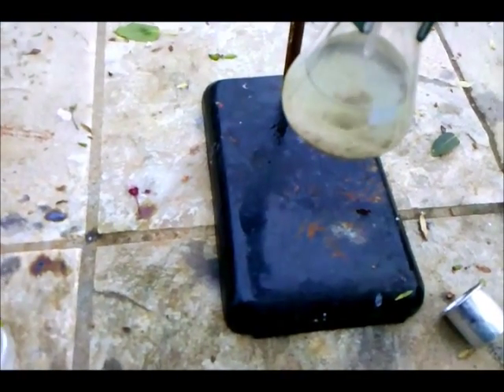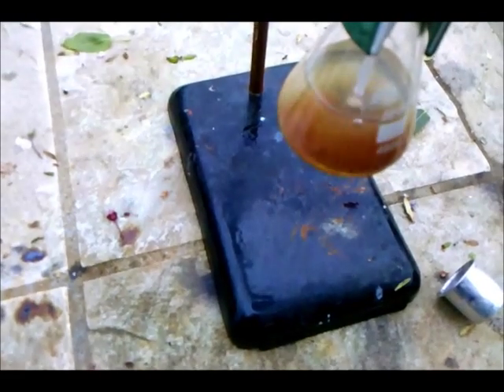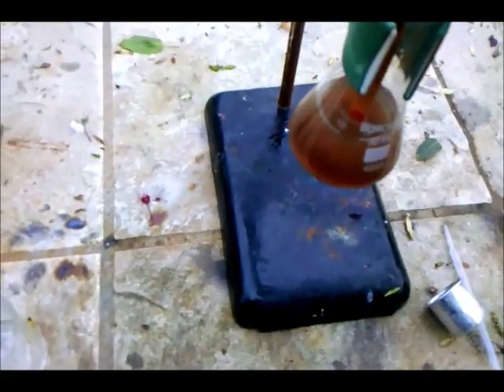So some potassium hydroxide is taken up and added to the mixture. You see the solution darken — continue to do this and take pH tests until the solution becomes basic. You can see that we're still very much acidic so I'll get back to you once the solution becomes basic.